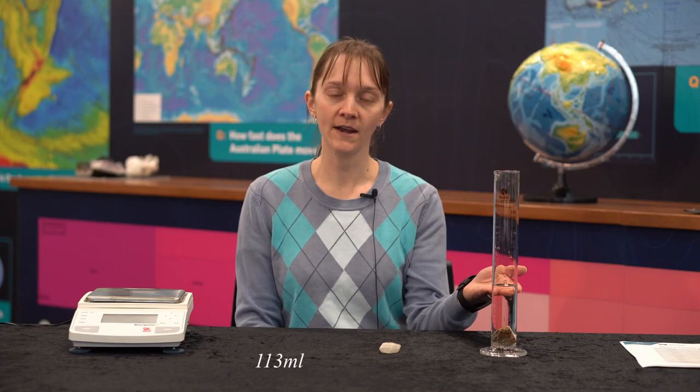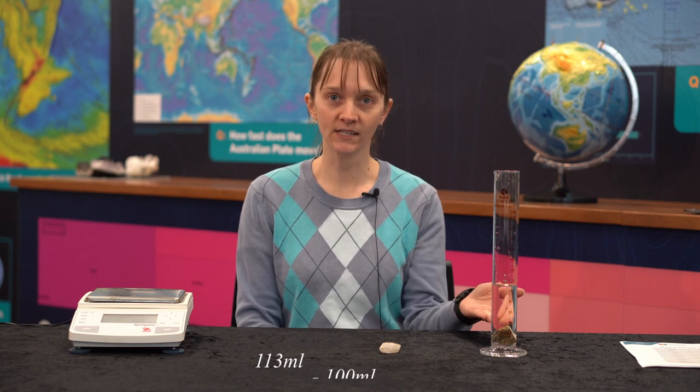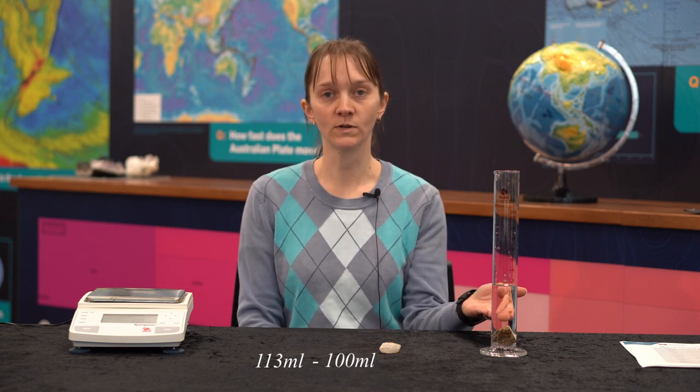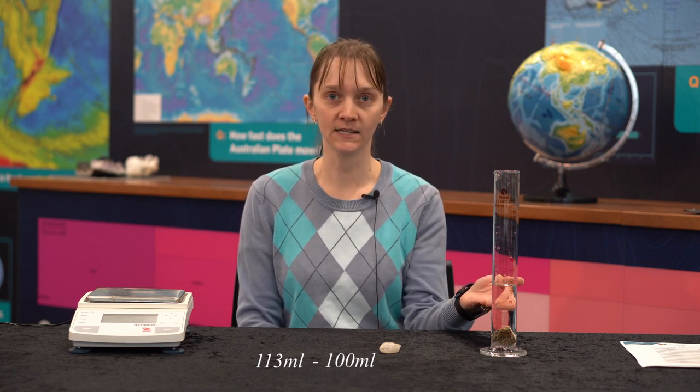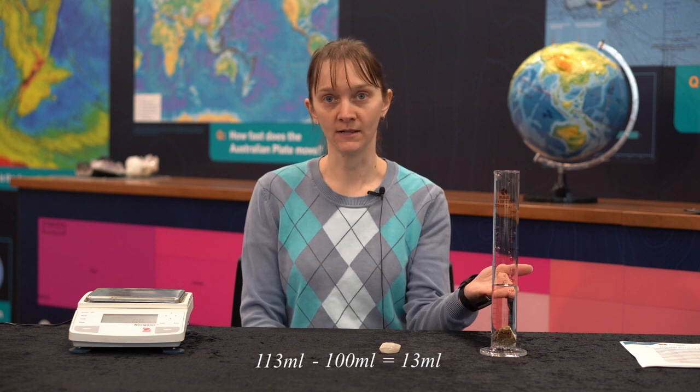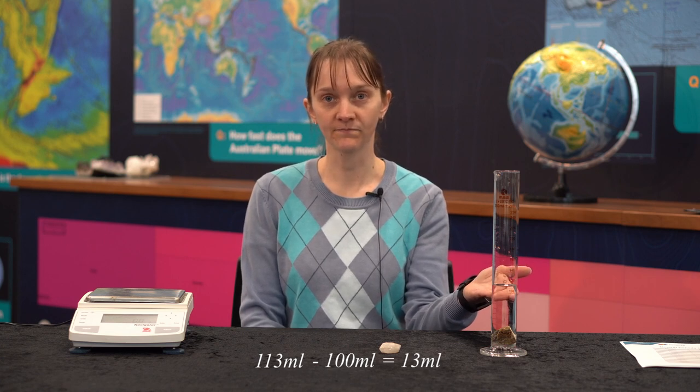We can calculate the sample's volume by reading the new height and subtracting the original amount of water in the cylinder — so in this case, 13 millilitres.